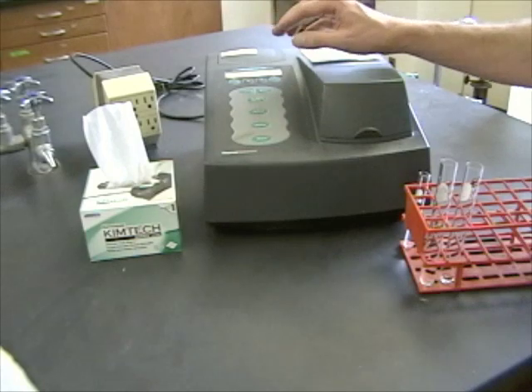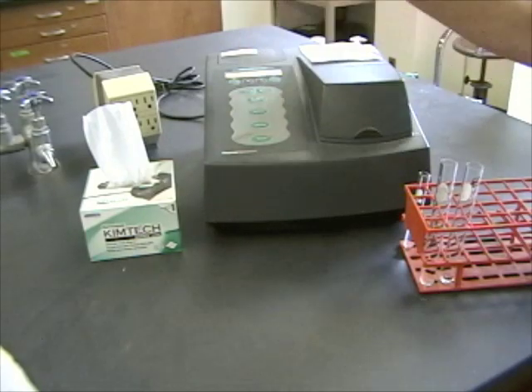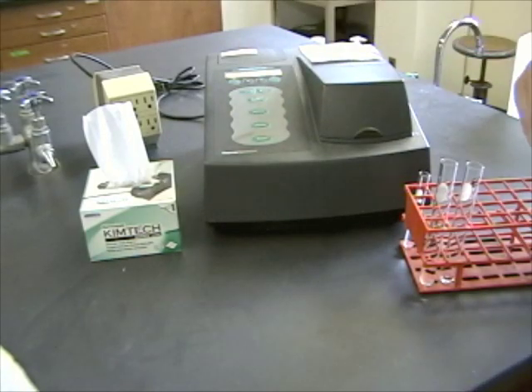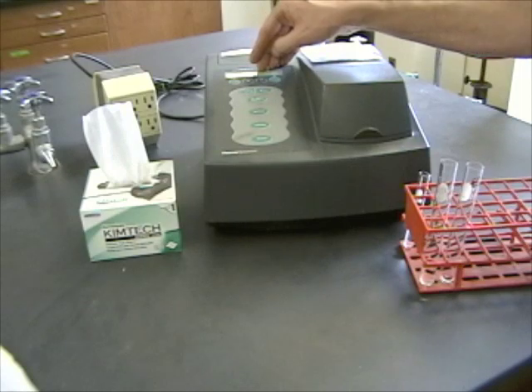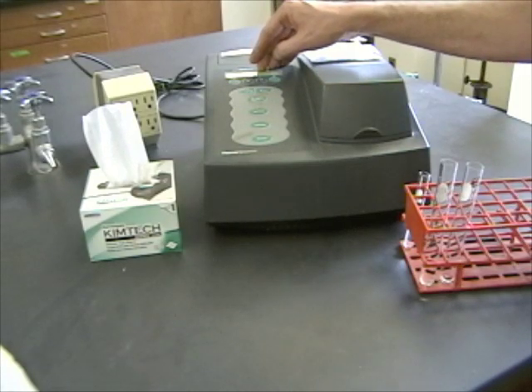Another thing you'll notice is that the numbers on the spectrophotometer are not going to stabilize and level off. That's because the reaction is actually going on. More of that amber-colored product is being produced all the time. So don't wait for the numbers to stop moving. They're going to keep changing and just take the numbers when you get to each time point.